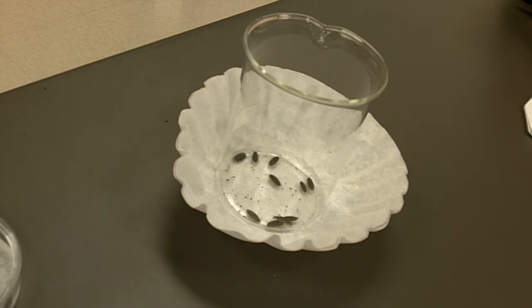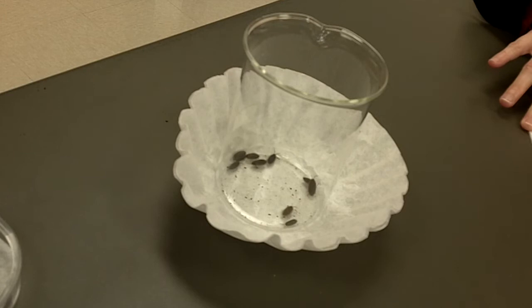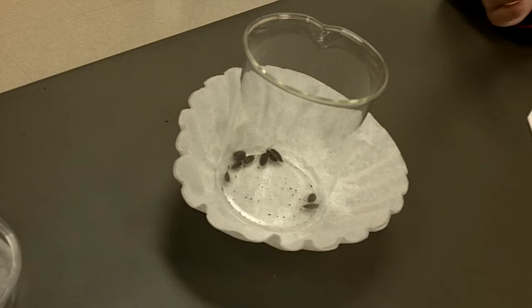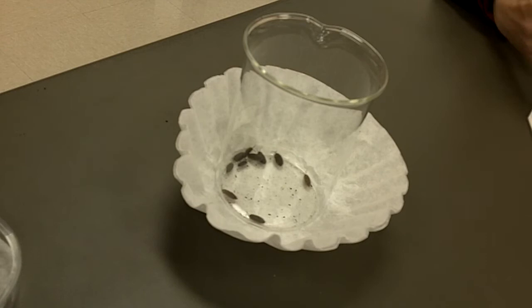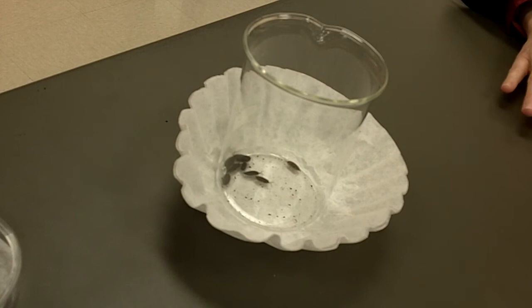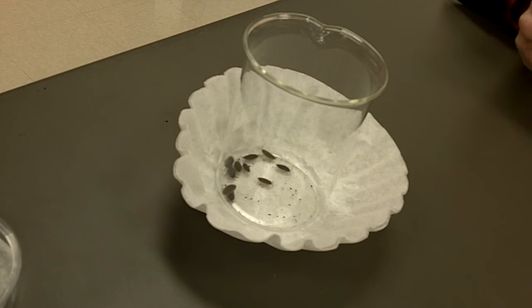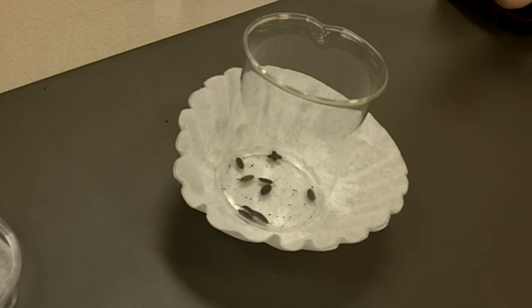We're not going to do the 30-second ones, but in a good experiment we've got background information now. We've already learned a lot by observing the roly-polys and by reading some basic information about them. When we look at our setup, we're timing them for 10 minutes. We're going to keep data on every minute of those 10 minutes on which side, wet or dry. Now we need to make a prediction. Do you think they're going to like the wet side or the dry side?